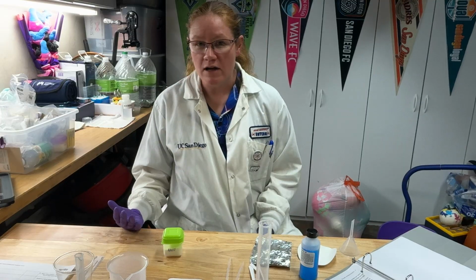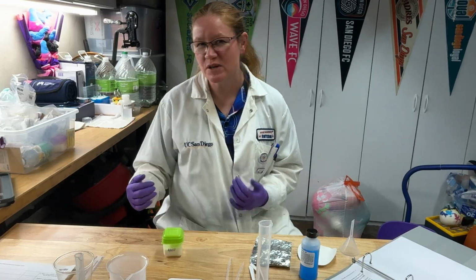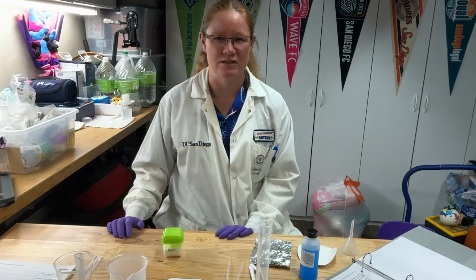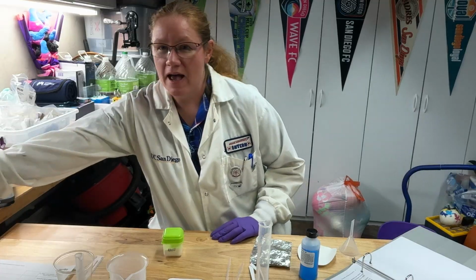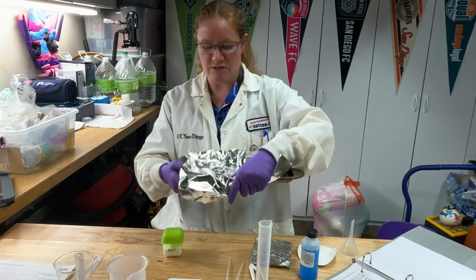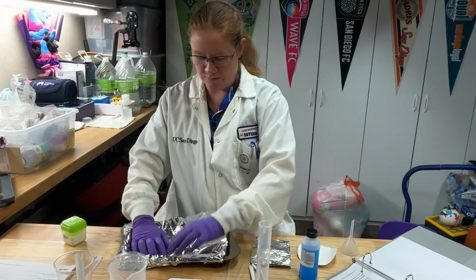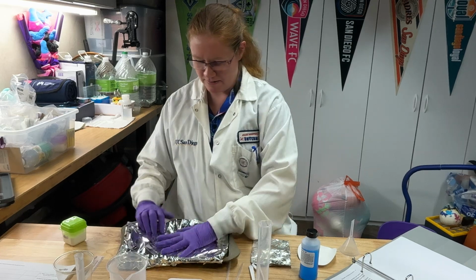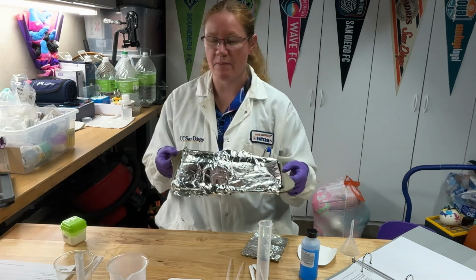Now, later on during this experiment, you're going to need to dry your product. You can dry your product overnight, but it takes a really long time. And if there's any moisture in the air, it's going to take even longer. So we recommend that you use the oven drying method. So I also have ready to go a little baking pan and an extra piece of foil. With my extra piece of foil that I got from my kitchen, I'm just going to line my baking pan so that I will be able to dry my product later.